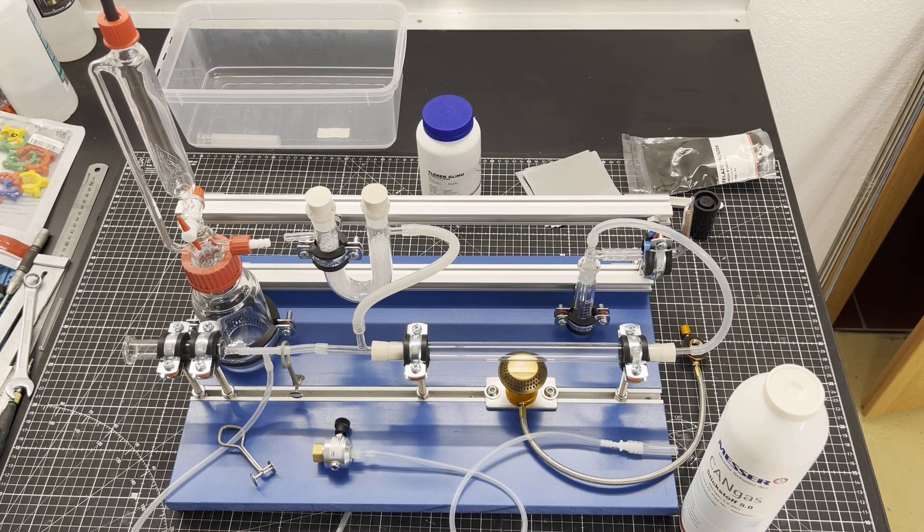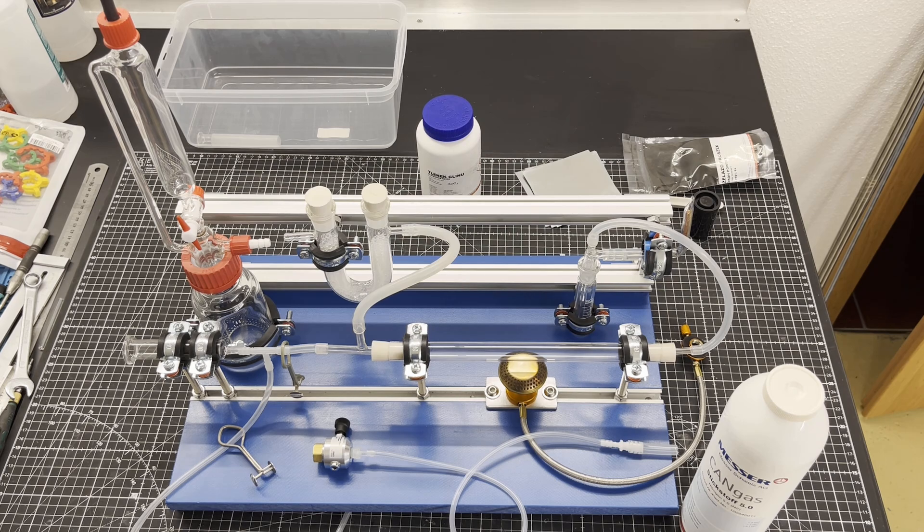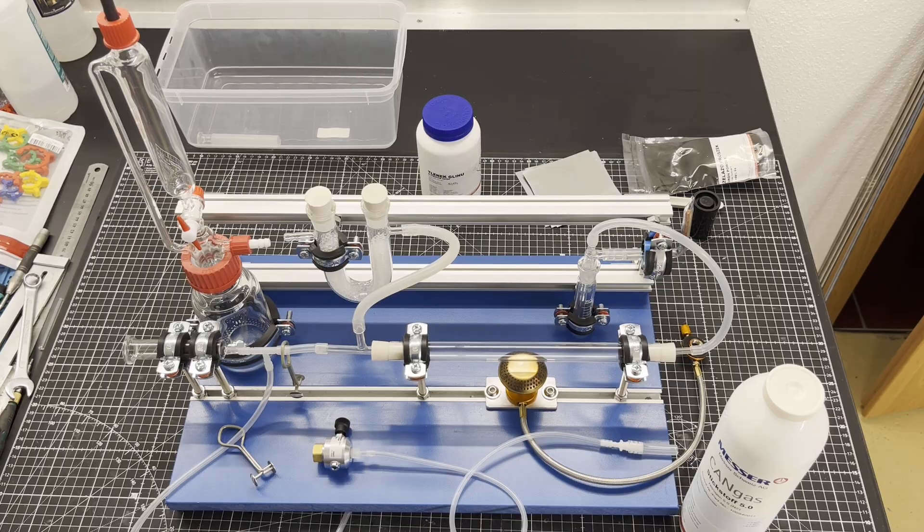Today we are trying to synthesize ammonia from its elements. The synthesis is also known as the Haber-Bosch process. I have set up these apparatus for this purpose. To begin with, I will show you how I built it. So let's get to the chopper.